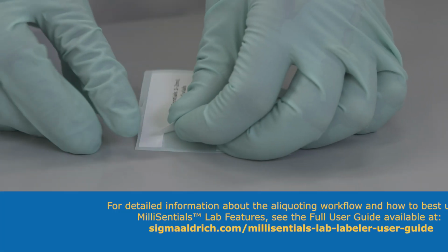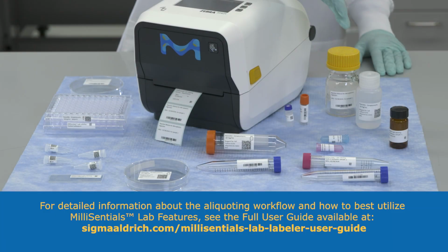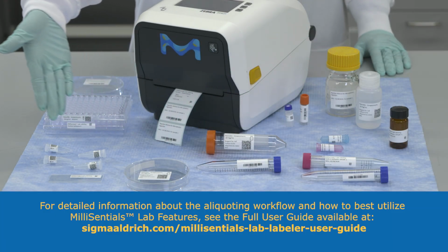For detailed information about the aliquoting workflow and how to best utilize MilliSentials Lab features, refer to the full user guide.